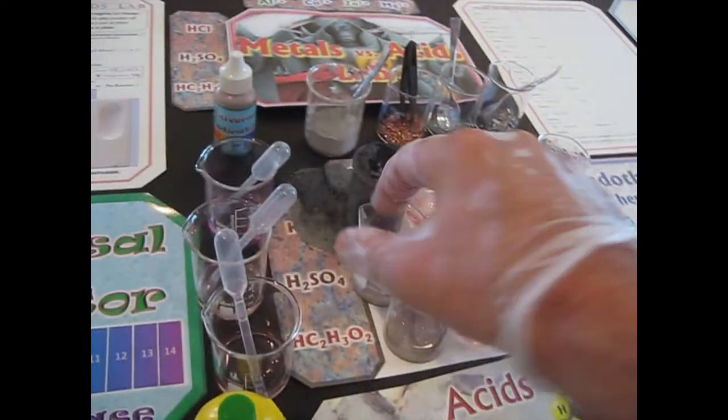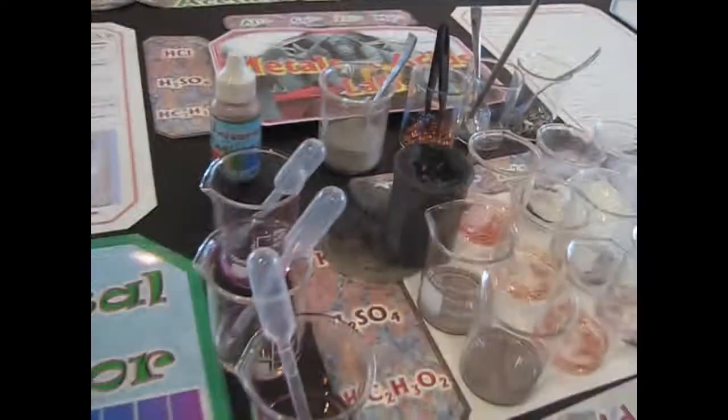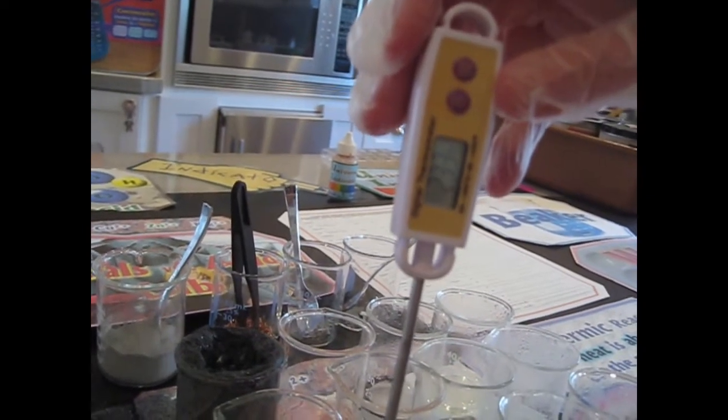Okay, and then the only ones we didn't do, let's go through these one more time. Let's do it again. I'm just going to do this first one first, because it takes a while to get this to full. I'd say 24 or 23. Oh, look, that's the temperature we started at. Very close. So not much going on in that one.